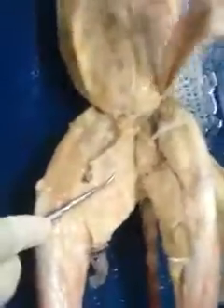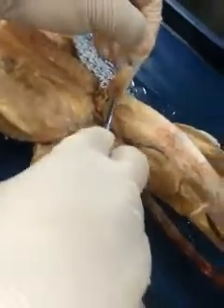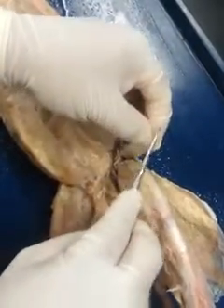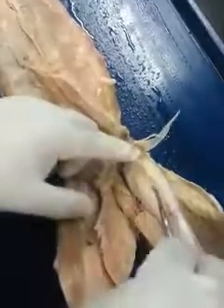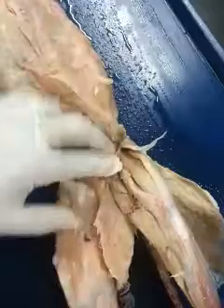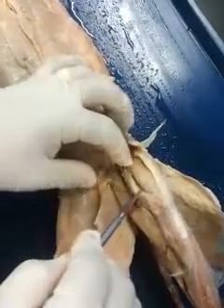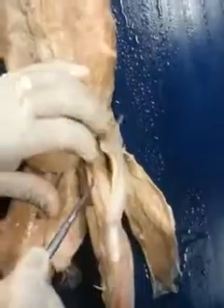So if we reflect those muscles, deep to that, you're going to see the tensor fasciae latae muscle. Right, and this is the muscle that contains the iliotibial tract, that thick aponeurosis here. The other deep muscles that we're seeing here now are going to be the quadriceps group. You have your vastus lateralis, the rectus femoris, the vastus medialis, and deep to the rectus femoris, you would have the vastus intermedius, which I can't seem to get to right now, but it would be deep.